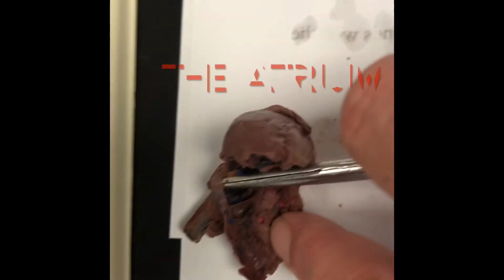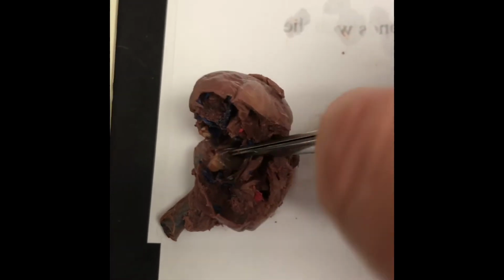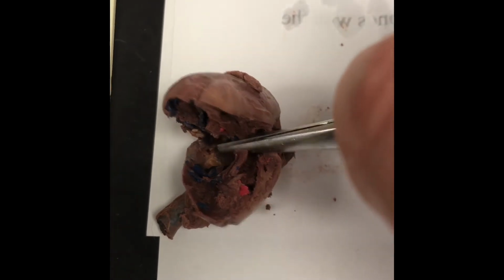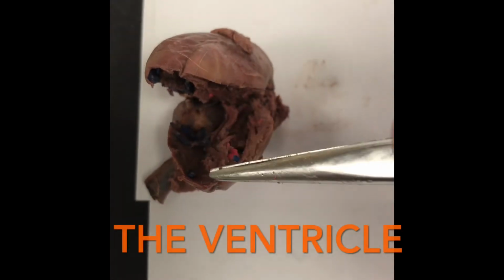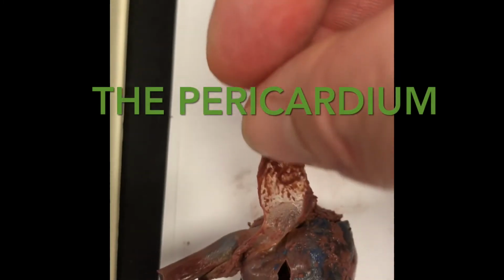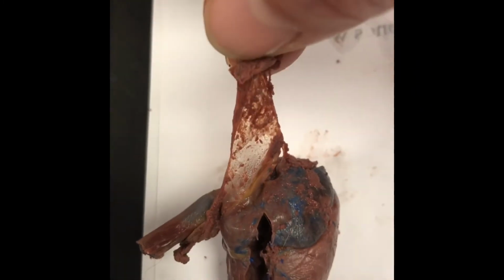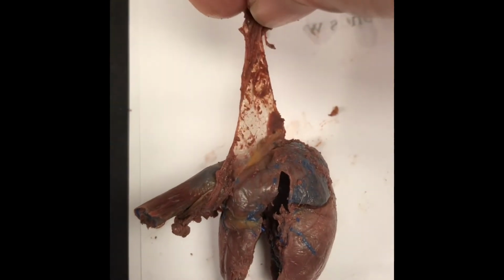So the heart's just sitting on its side. You have the atrium up at the top, and then the ventricles are down at the bottom. So the atrium make the top part of the capital A, and then the ventricles down at the bottom. Here is the pericardium, so the sac that covers the heart, the pericardium. That is what that looks like.